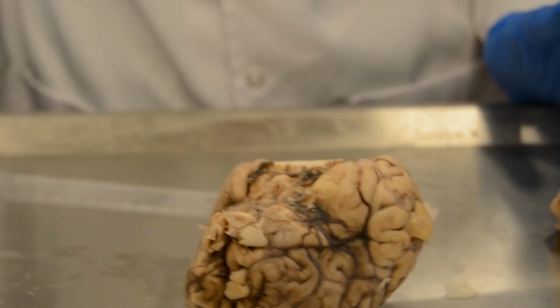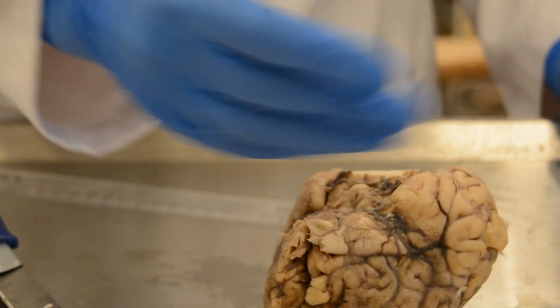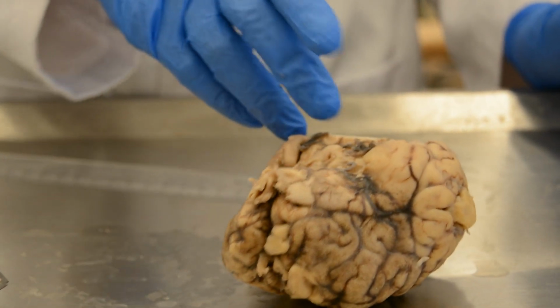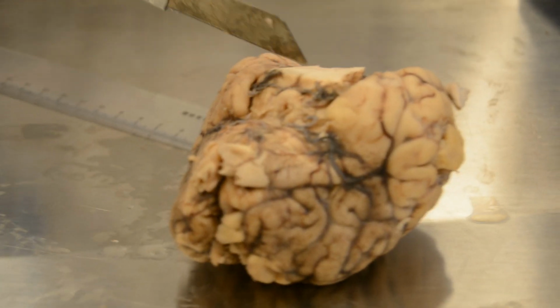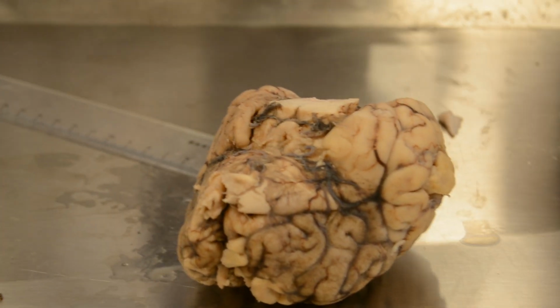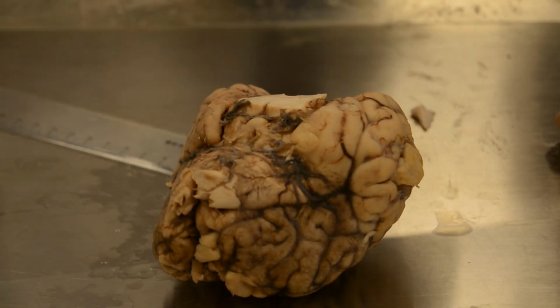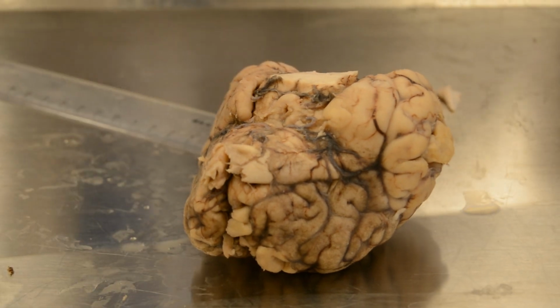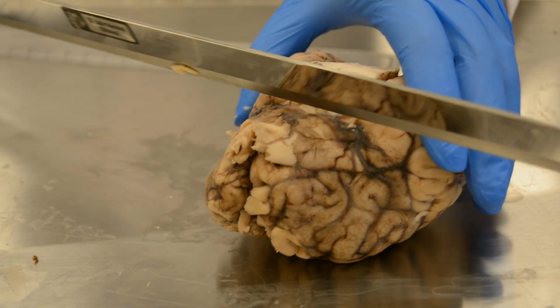Can we revise our 4 main cuts? They will be at the level of the temporal tips, the optic chiasma, the mammillary bodies, and 2/3 the way between the interpeduncular fossa and the aqueduct of Sylvius. These are very close here in a cow's brain. It's not like a human brain, where they will be widely separated, and between every level and the other there will be 2 to 3 cuts. Our first cut will be at the level of the temporal tips.